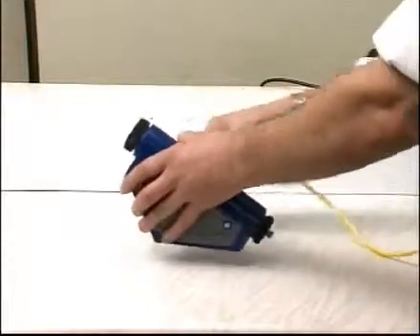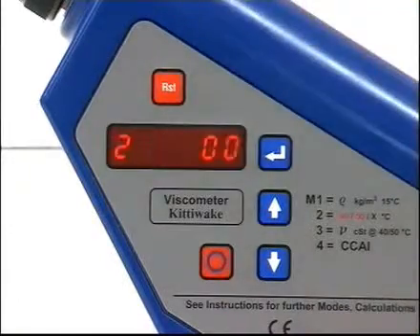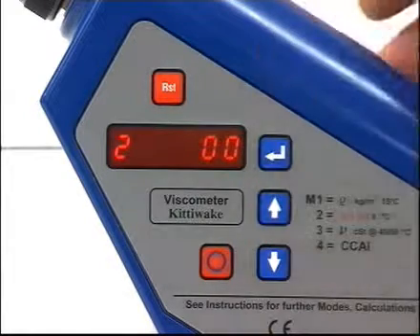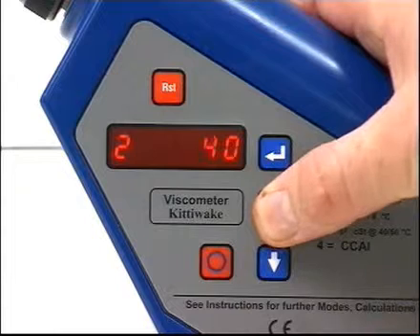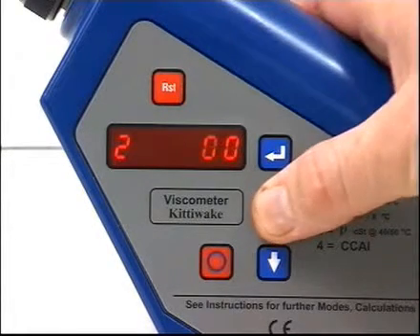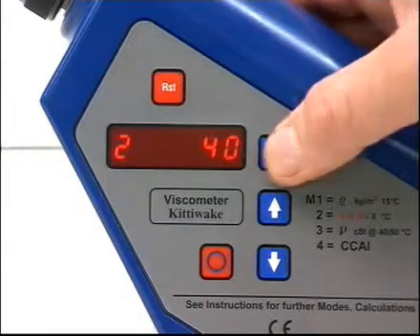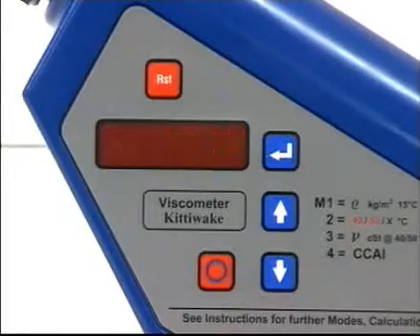To take a measurement, start by pressing Reset. You can use the arrow keys to move between temperature settings. Press Return to select the setting. The temperature display will flash as the oil is heated, and the degree symbol will flash until the oil temperature is stabilized.